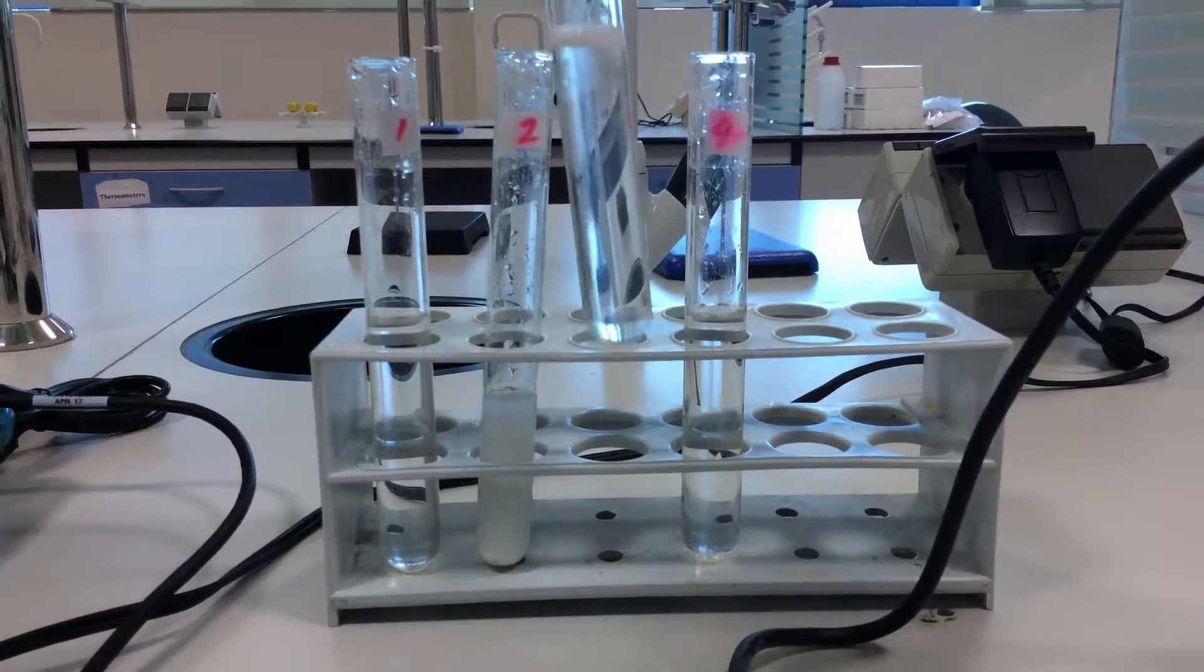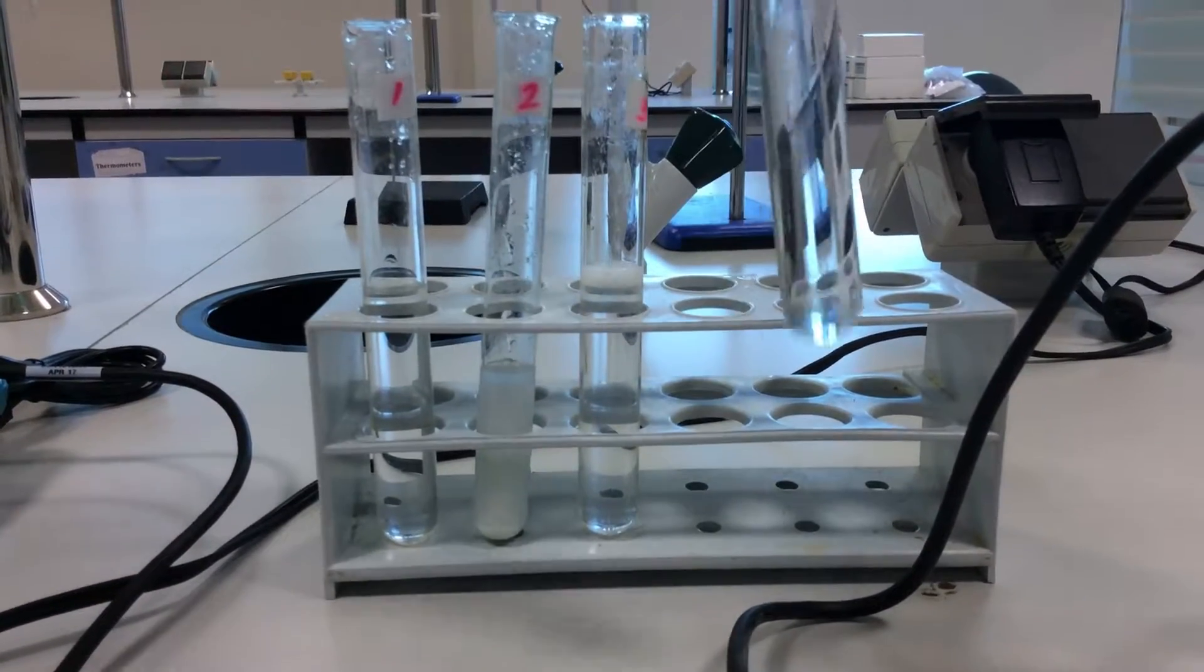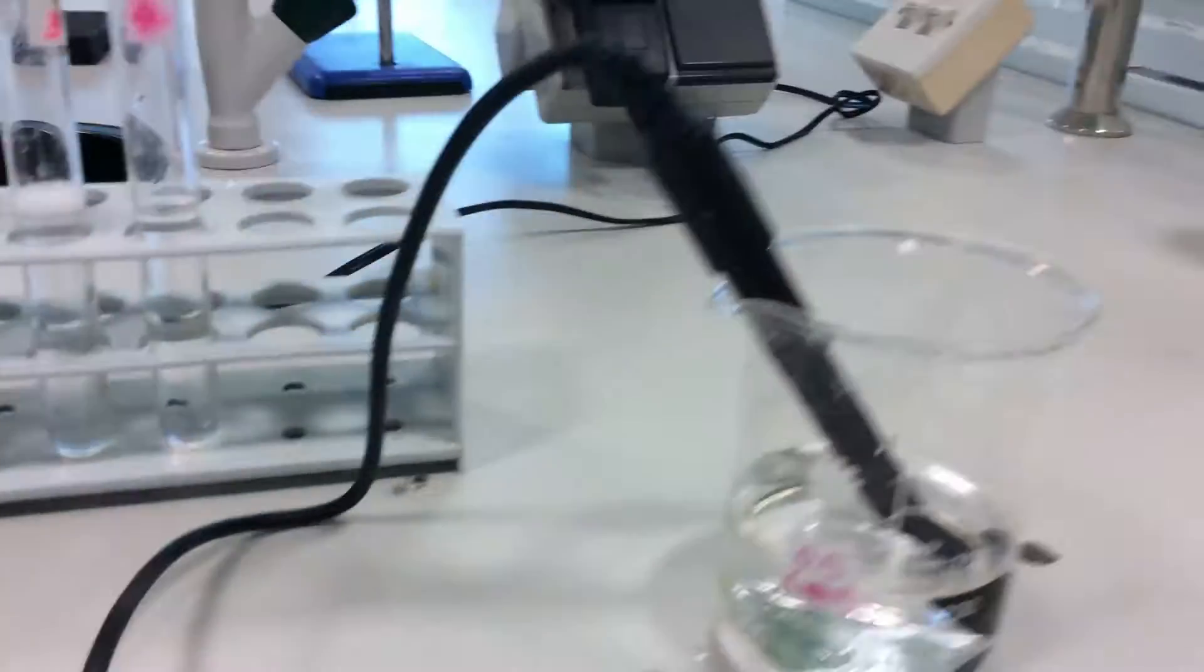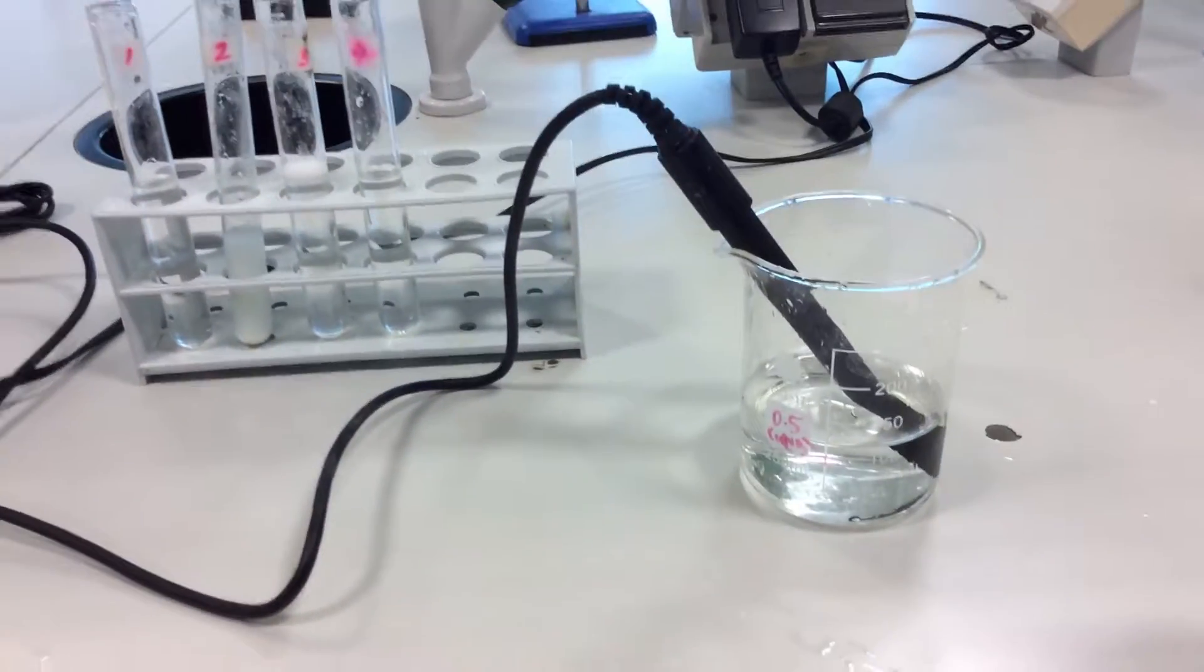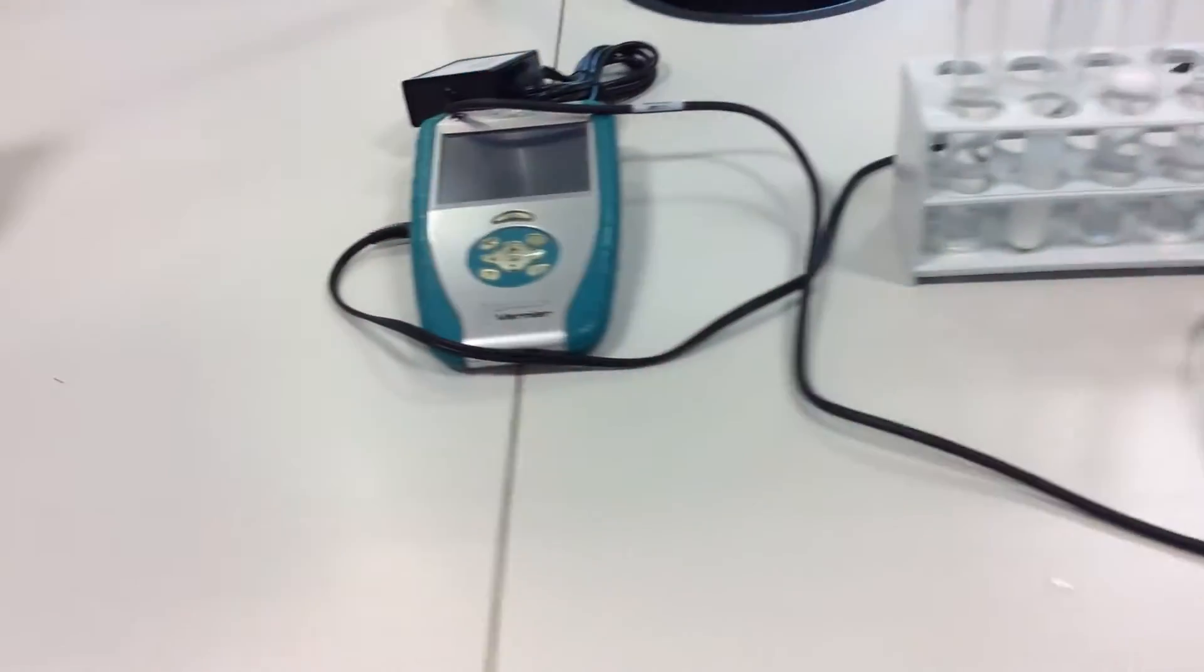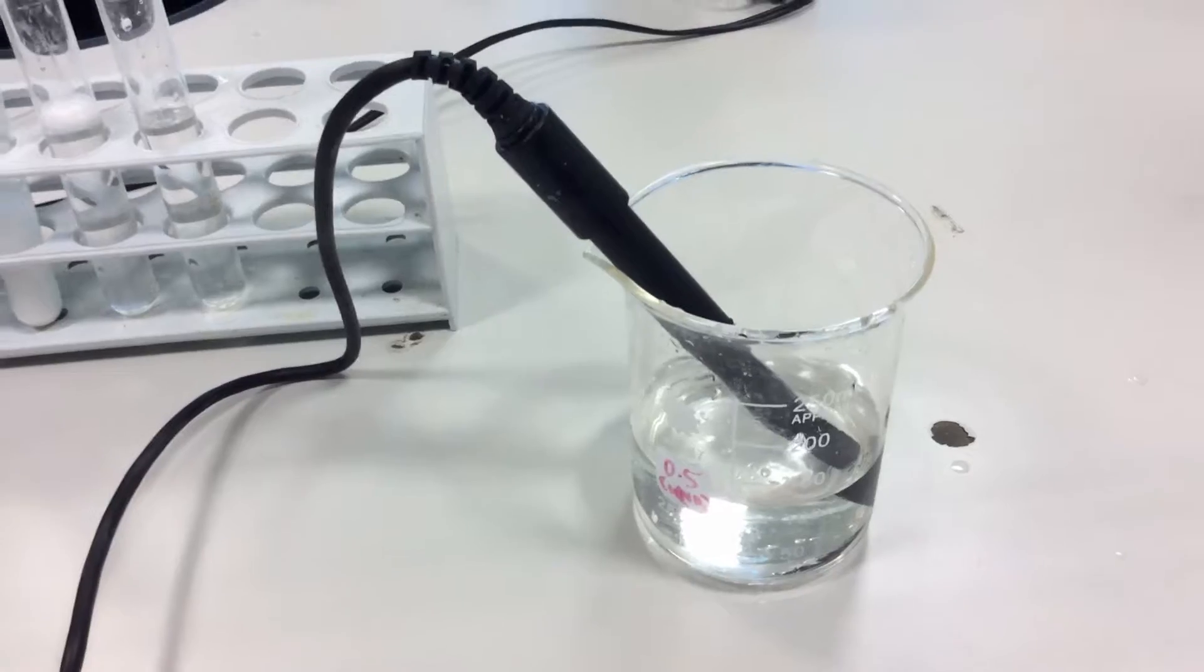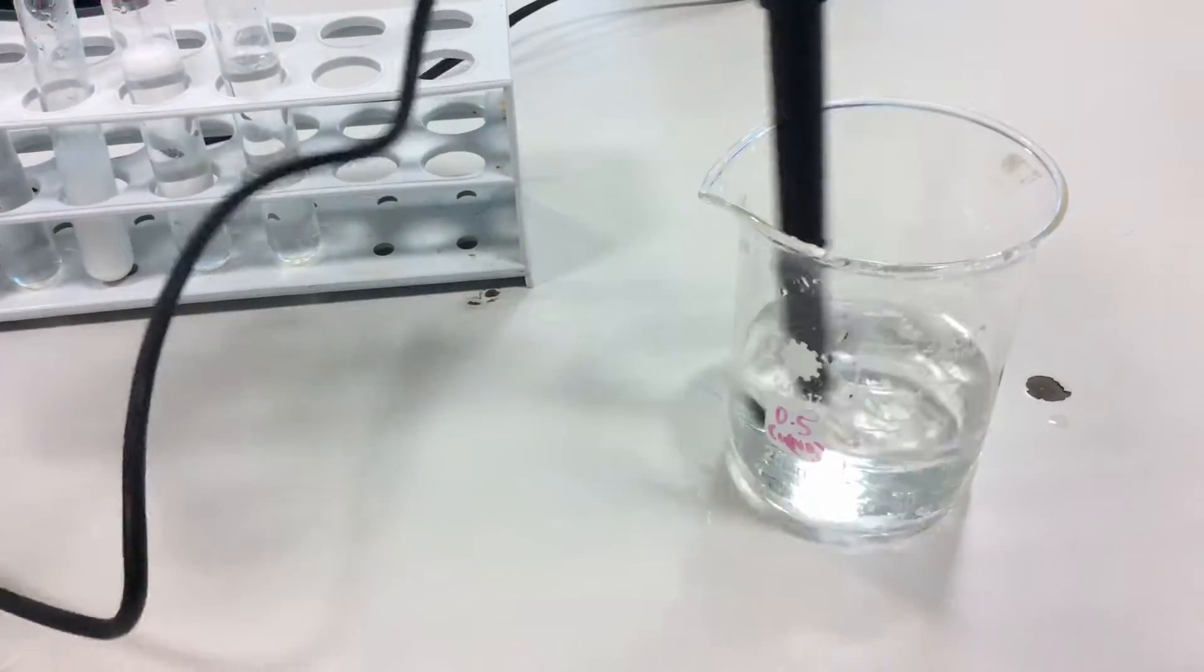Here you can see a conductivity sensor connected to a LabQuest, which is going to give us the result of the value of conductivity. This conductivity sensor is dipped in distilled water.